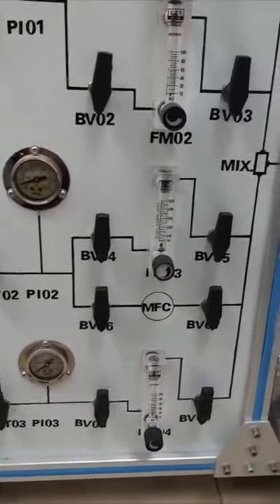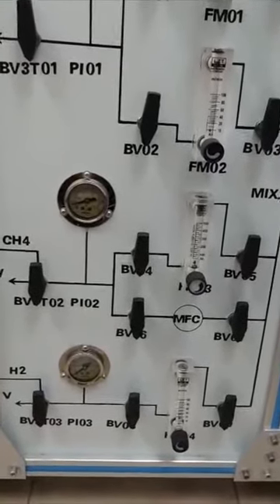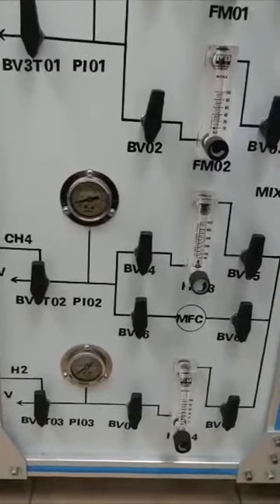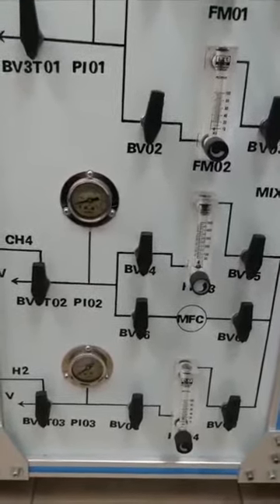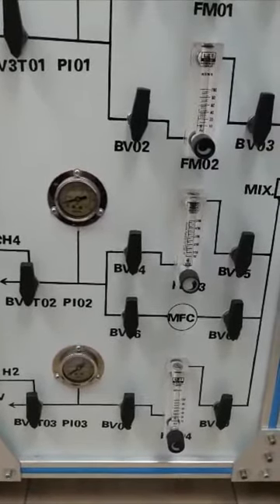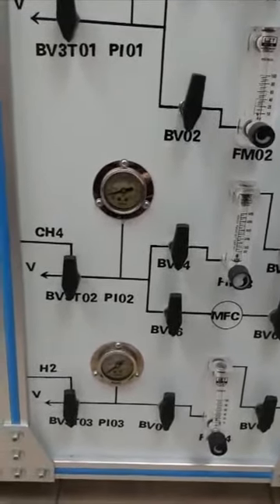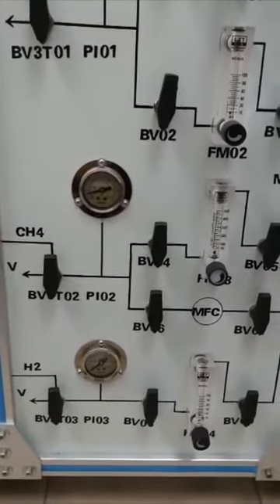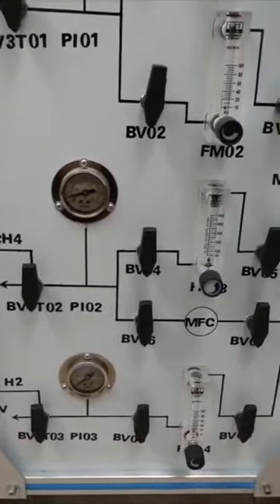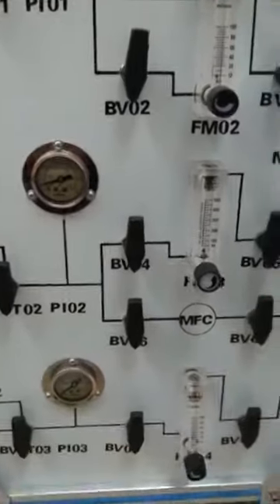So initially this hydrogen line was installed for the future. In future, if you install a furnace, then your reforming system becomes a classical reforming system, so you can work at high temperature. Then at that moment you can do the reduction of your catalyst. So based on this condition, if the hydrogen is not being used, you can use this line for another function, for example, to supply your reactant gas or your mixing gas. So this is the function of hydrogen.